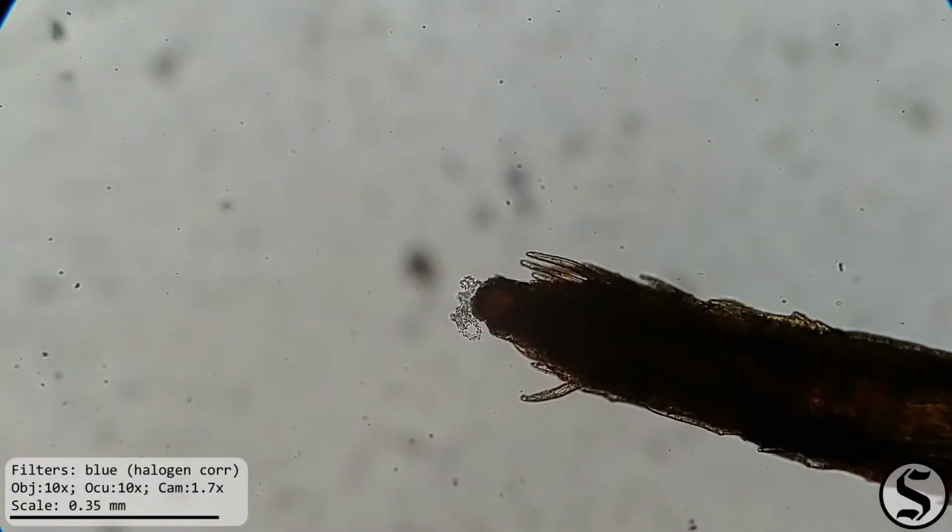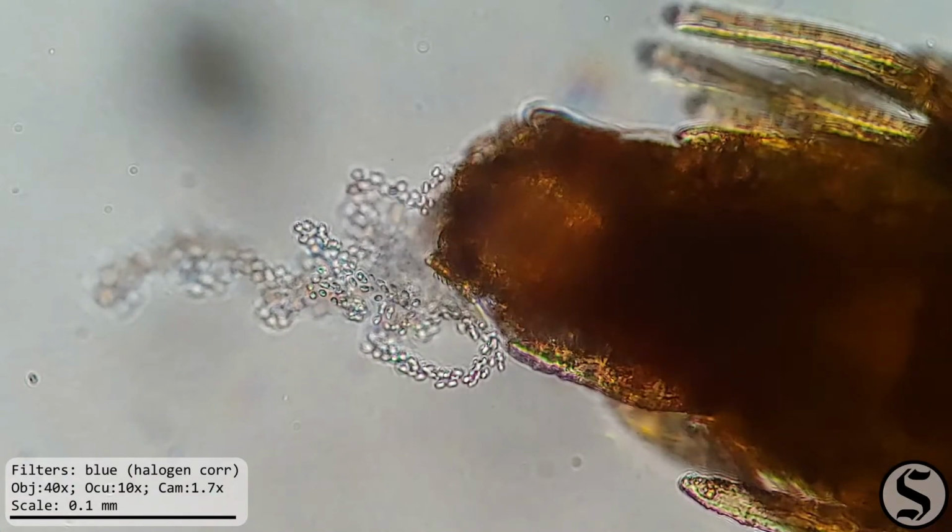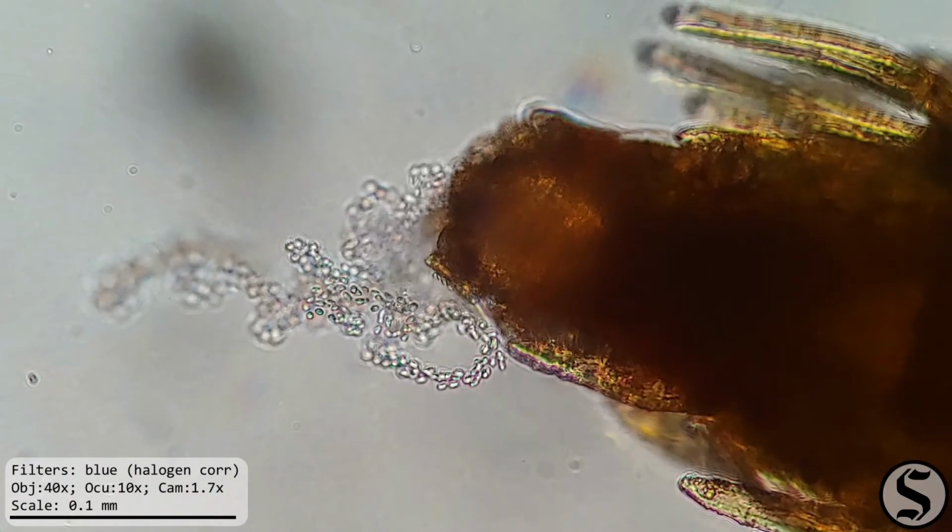Zooming in, we can see there's something on the end there. What is happening? I think there are spores coming out of there. Zoom. Enhance. Check that out.